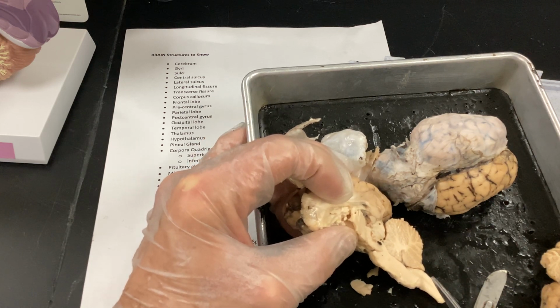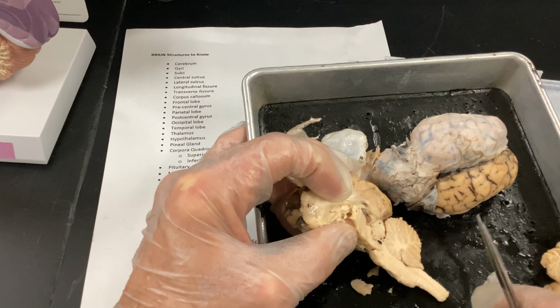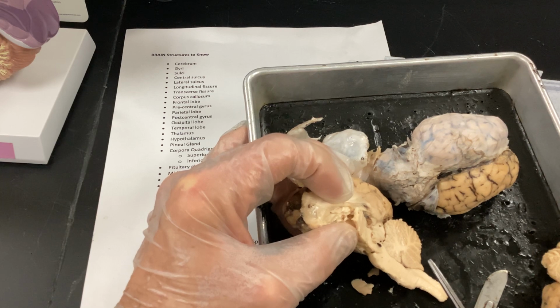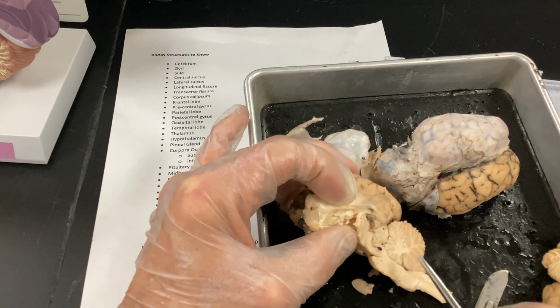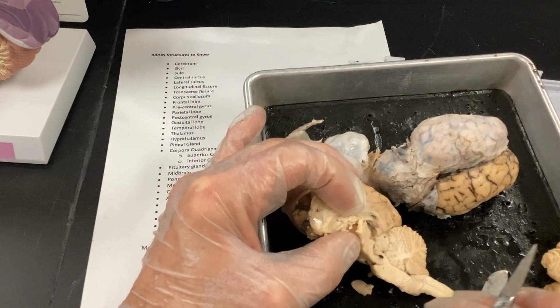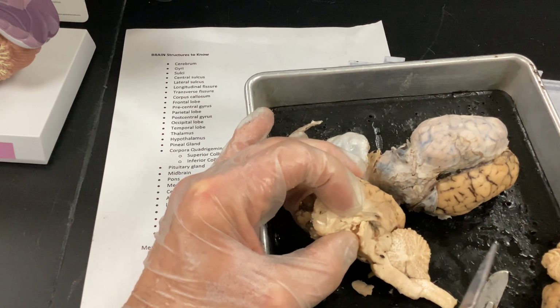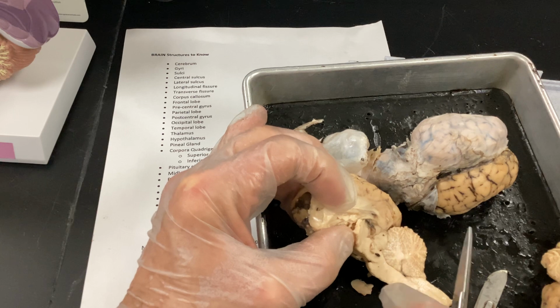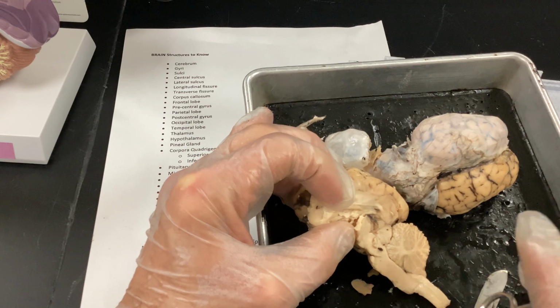So the dorsal, there's a dorsal root ganglion where all those cell bodies come together. And in lecture, we talked about shingles and how the virus can sort of hang out in the dorsal root ganglia. It's kind of sequestered from the immune system, and if you're stressed out or your immune system is diminished, it can literally leave the dorsal ganglion, and it travels down those sensory roots generally, and that's, we talked about the dermatomes, right? So those areas of the skin that are directly linked to that area, and we talked about intercostals. Remember, costal means rib, and how a lot of people are affected in the thoracic area. It comes right out there, and it starts affecting those dermatomes.